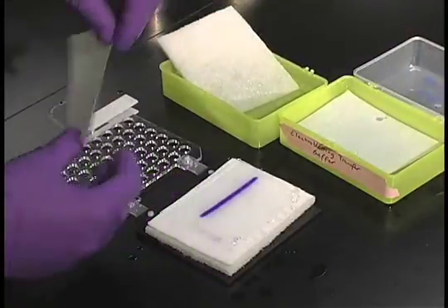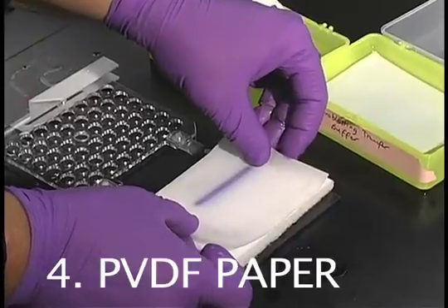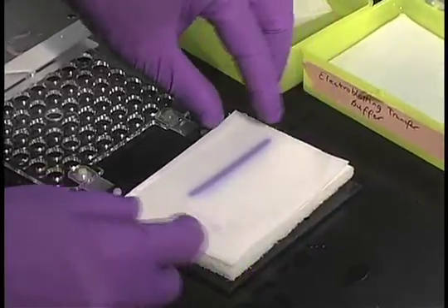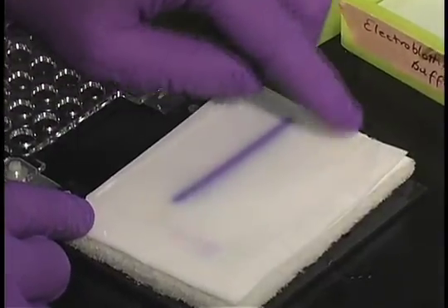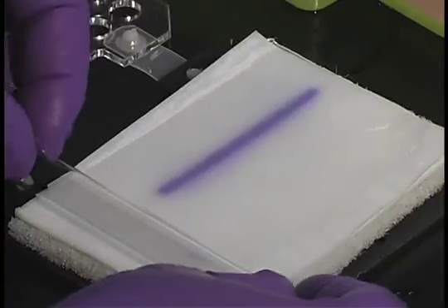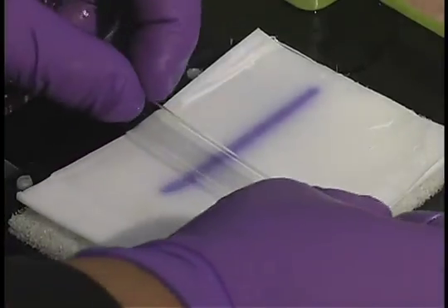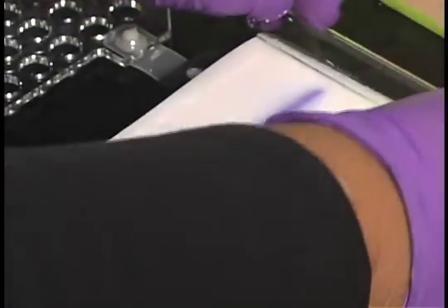Then our PVDF paper. It's important to make sure we remove any bubbles between the gel and the paper. One way to do this is to take a test tube and simply roll it across the membrane. That will push any bubbles to the edge.